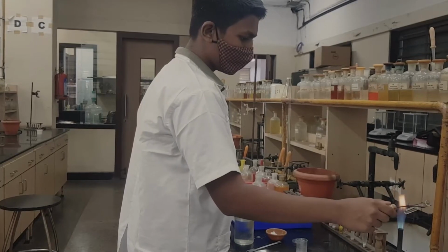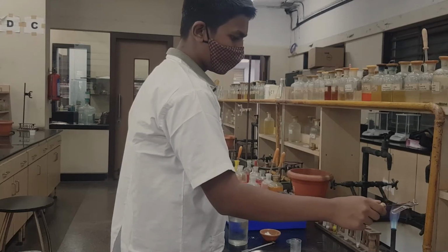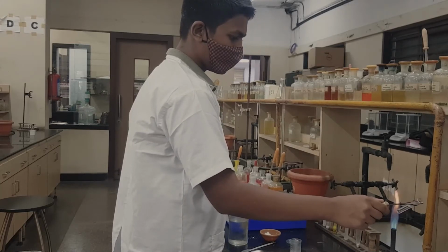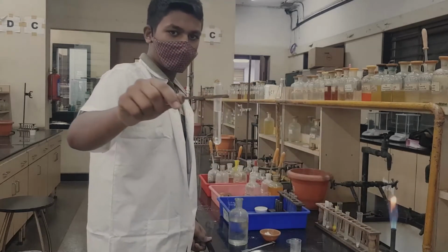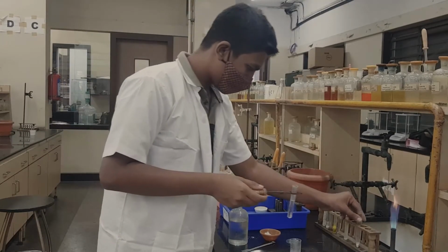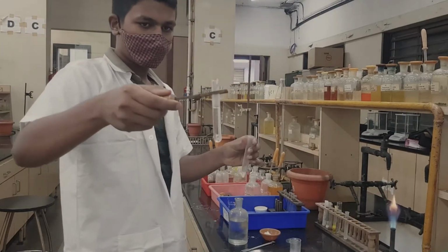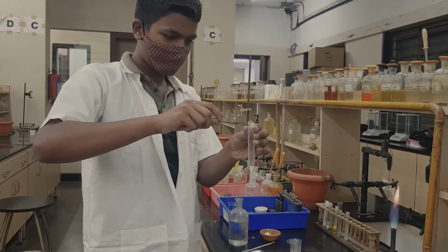You do not have to boil the solution, just warm it a little. So this hot acetic acid, we are going to pour onto the white PPT in the centrifuge tube.